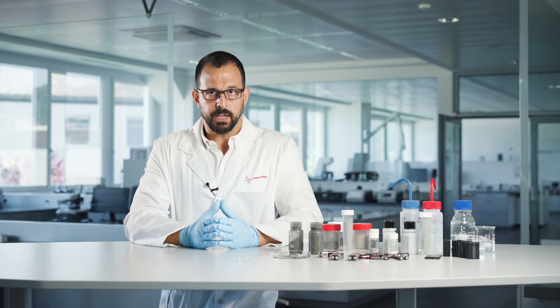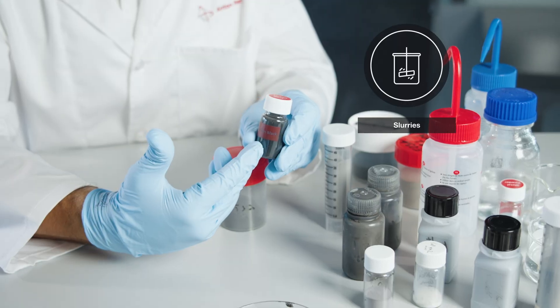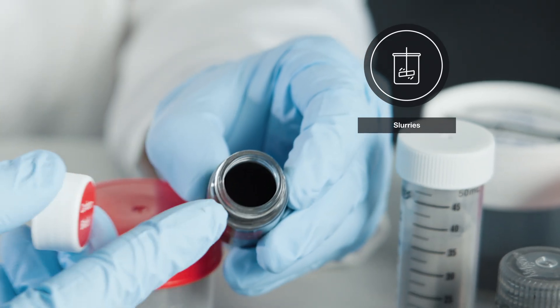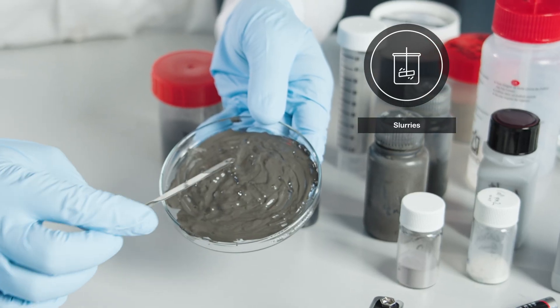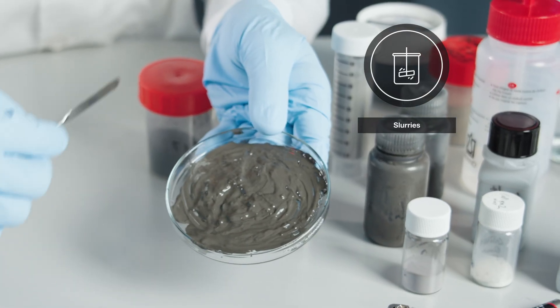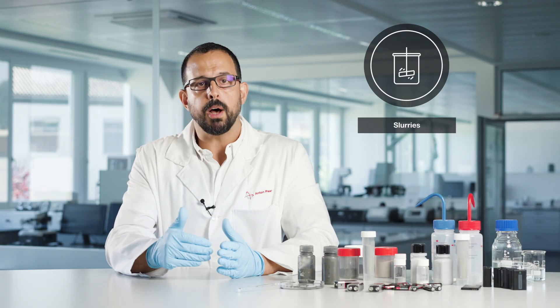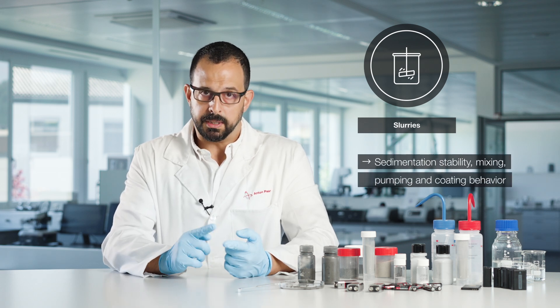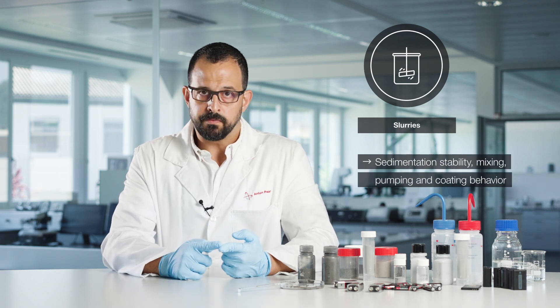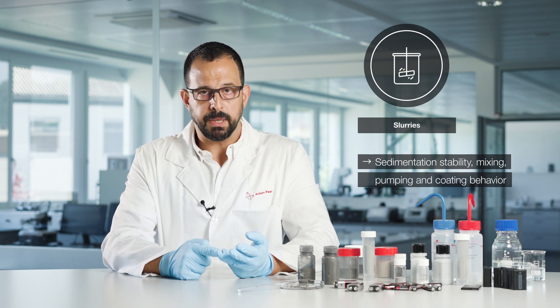In the next stage of the manufacturing process, the powder raw material is mixed with binders, conductive additives, and a small amount of solvent to form a homogeneous slurry. Here, specific physical properties of the battery slurry are very important in order to optimize the subsequent steps of the manufacturing process. Such properties are sedimentation stability, slurry behavior during mixing, and behavior during pumping and coating.